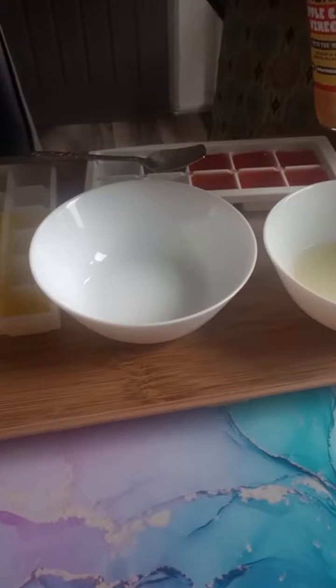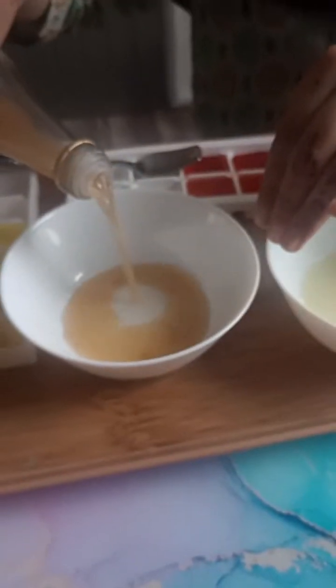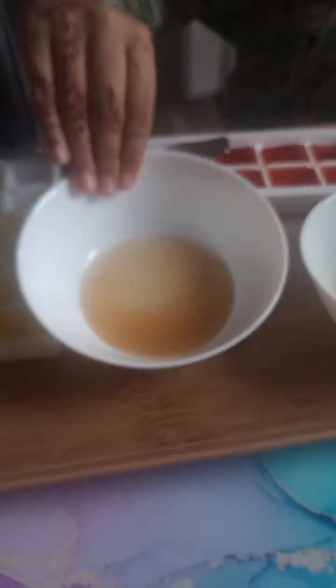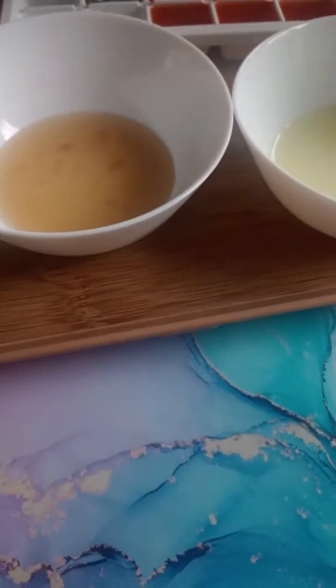Right? So this is what we're going to add again. So what's going to happen is, have you ever wondered how substances move in and out of cells? Well, this is a colourful experiment that we're going to do. This colourful experiment gives us a tasty way to find out.